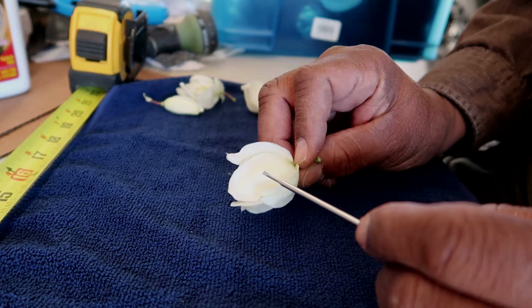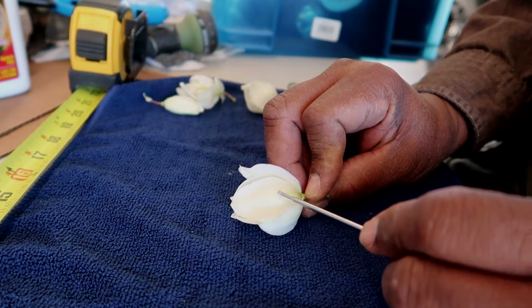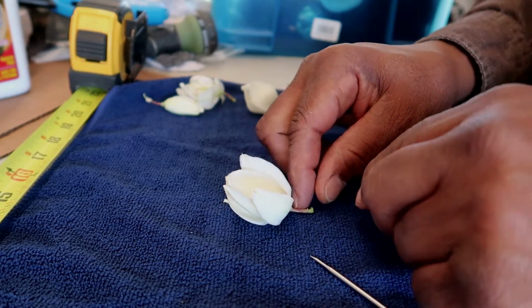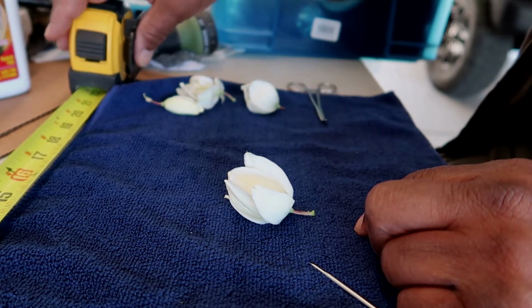And it's more elongate than the actual petal, which doesn't have that line, and it's wider in shape. So in order to see what the plant looks like, we'll have to remove the sepals.